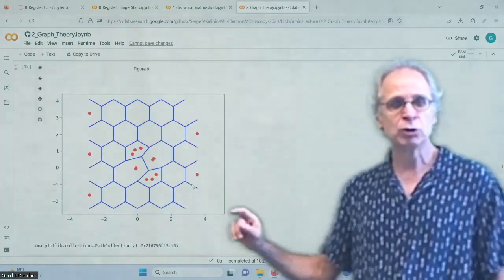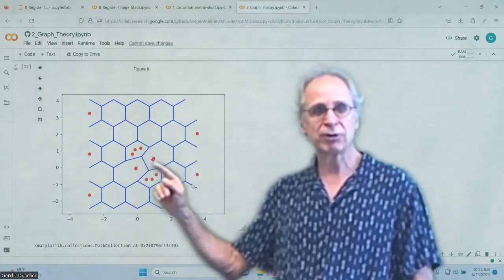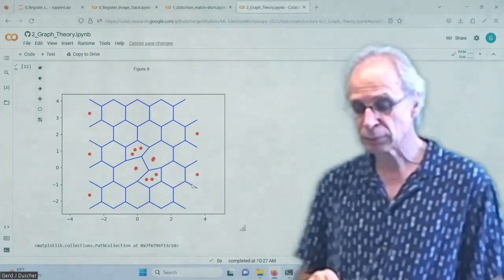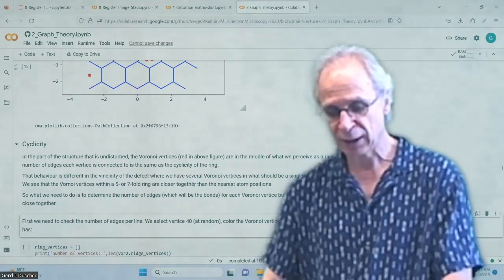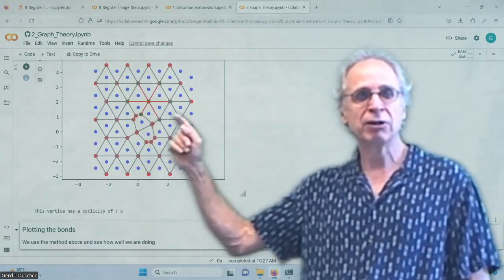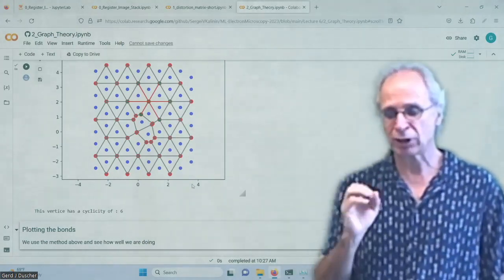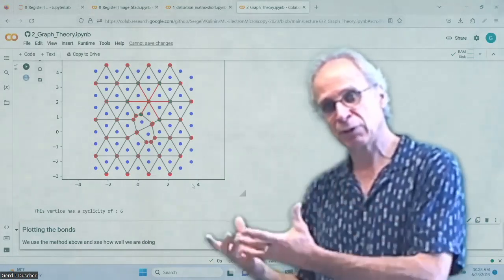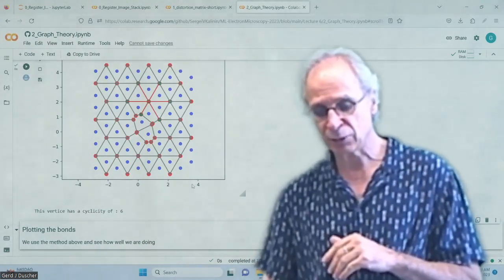And so what did we really do? If there were no vertices, where we have only one, we don't plot them, but where we have several of them, we plot them, and then this is the center of our ring, and this ring is then colored depending on how many vertices it has. So the cyclicity is just the number of vertices around there. And I also can now determine how many nearest neighbors each atom has, right? So this one has 6 nearest neighbors, and I just know that because I have all the information in my graph. I have not only the rings, but also the connections between the nodes of the graph, my atoms, and those are going to be my bonds.